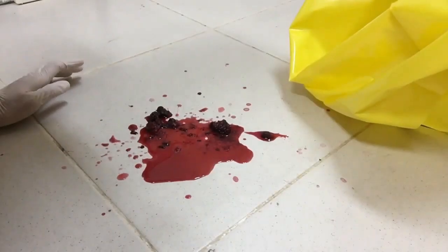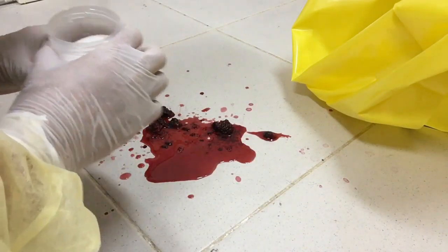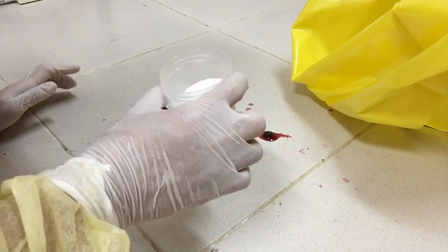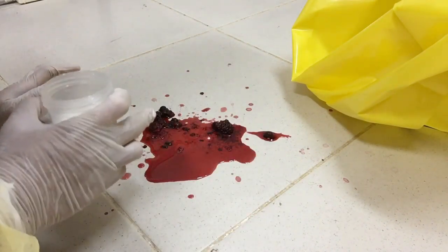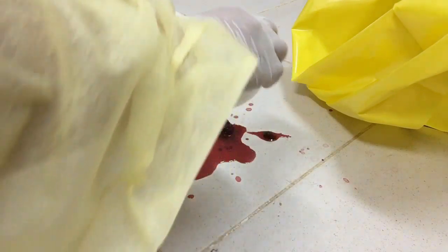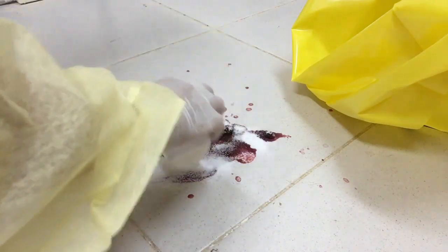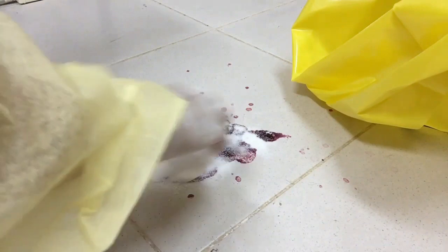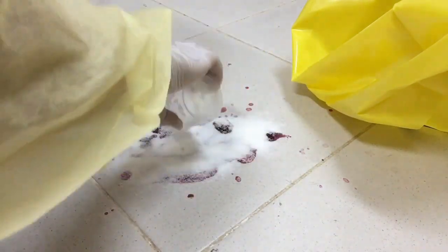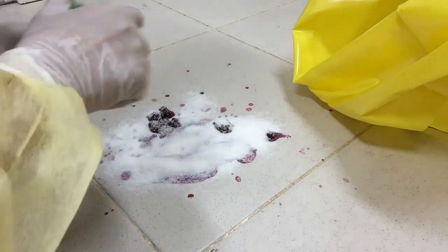This is the real scenario — this is the blood spill. I have already worn my PPE. The caution board is already placed in front of the door so nobody can step on it. This is the absorbent powder — I have to put it here. We will wait for at least 2 minutes.